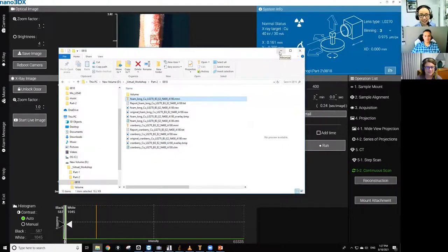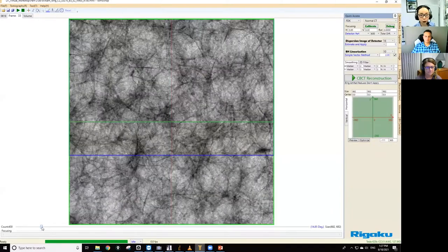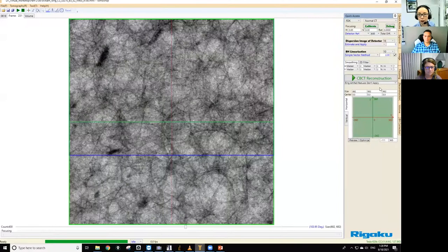Okay, so let's take a look at the scan. Did I open it? Oh, there it is. Okay. So we have 400 projections. At a glance, it looks fine. So let's go ahead and do the reconstruction.